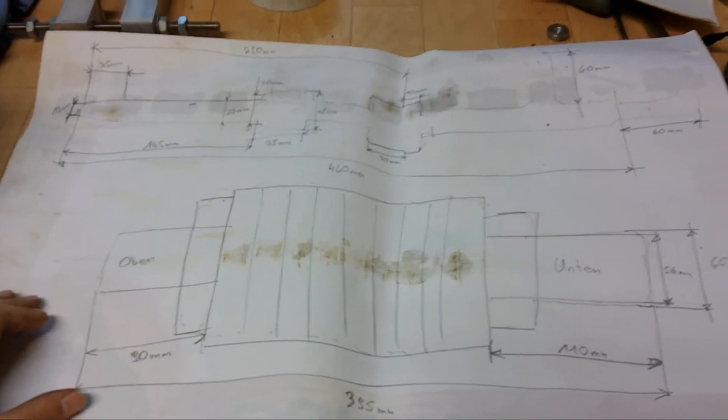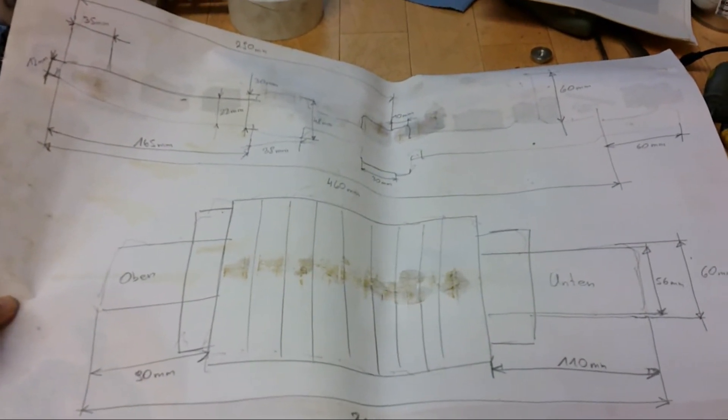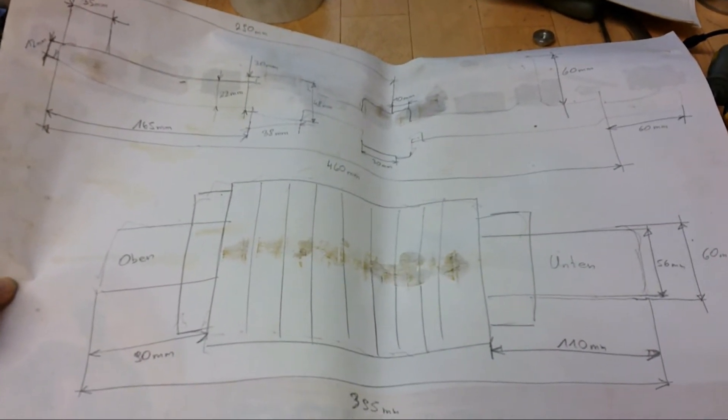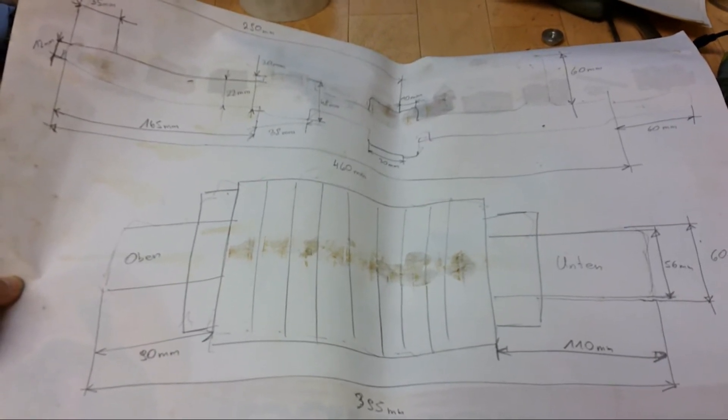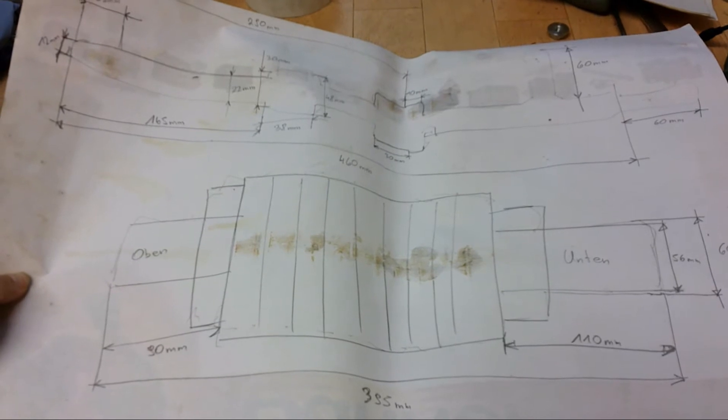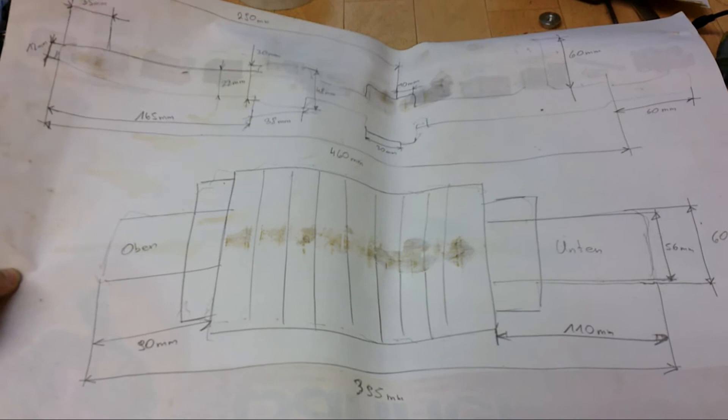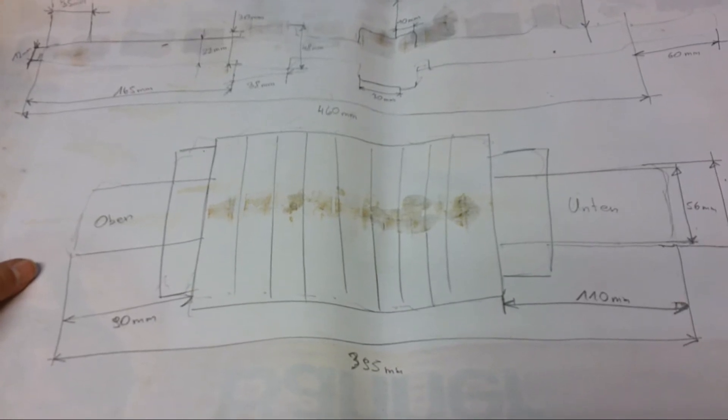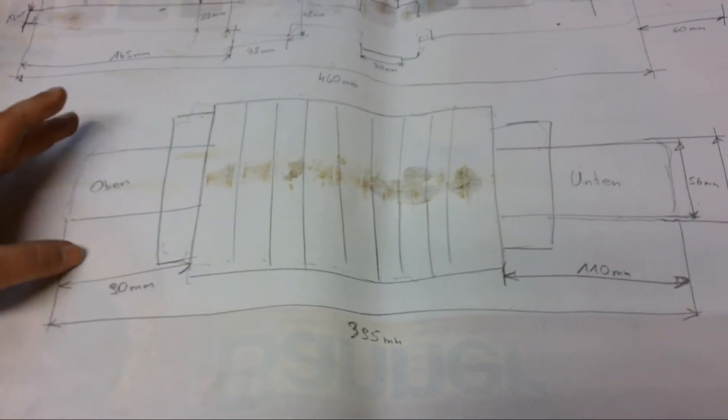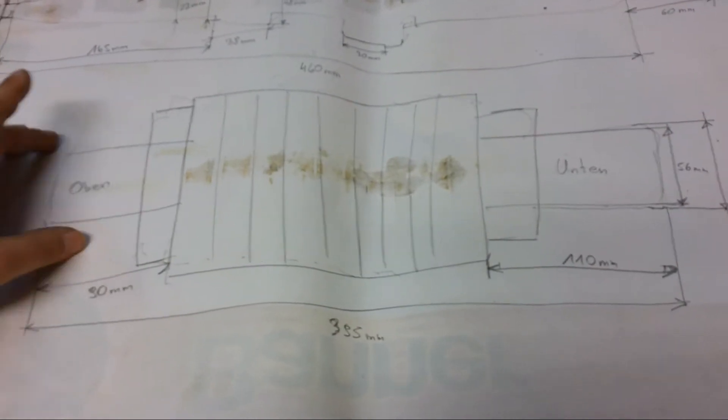So this is now the drawing. My next step is to draw this on the computer and to think about how to reassemble everything, what to replace, and what I should leave as it is. So for example this tube and the magnets I will probably leave as it is, just make a more proper and more tight lid on the top and on the bottom.